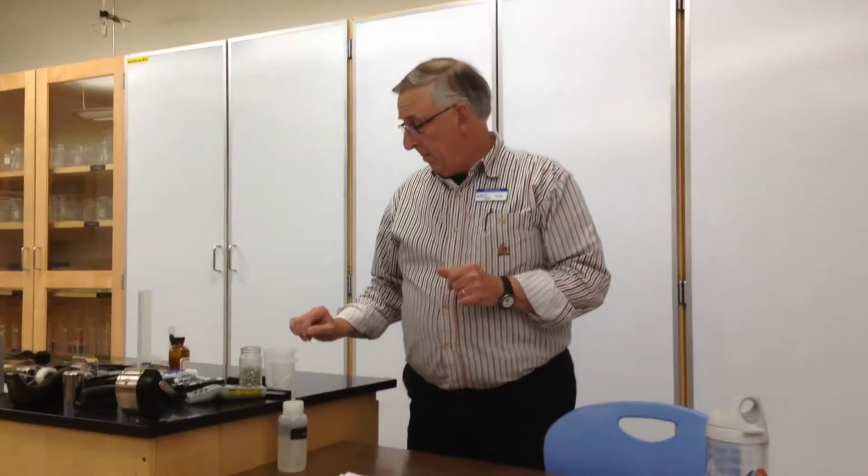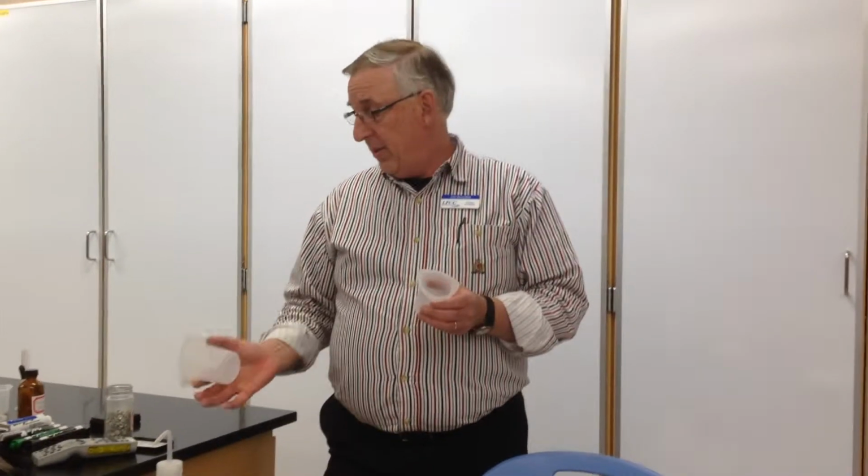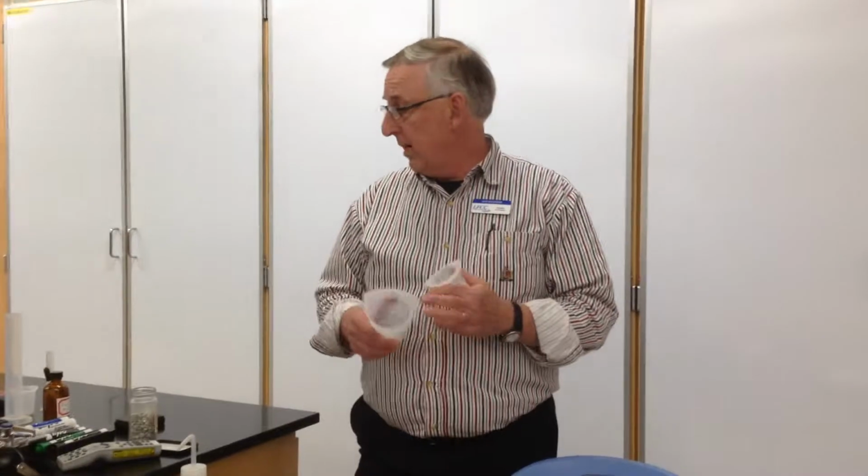All right. Now, I've got a data sheet that's attached. And again, this experiment can be done at home or anywhere students might be. And actually, I'm not trying to make an appeal or endorse any company, but eScience Labs have sent us a lab kit. So all these items that I'm using are from the eScience kit. Not the actual metal in it, but as far as the beakers, the Erlenmeyer flask, you can see the little electronic balance. We got the kit this week free of charge for us to, again, evaluate here at Lord Fairfax, and to give equal time, Hands-On Lab is actually sending us their kit too to evaluate.